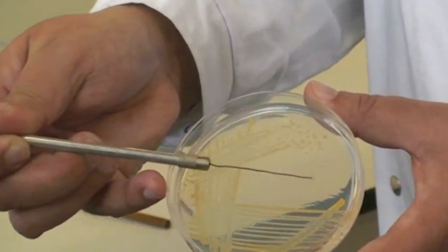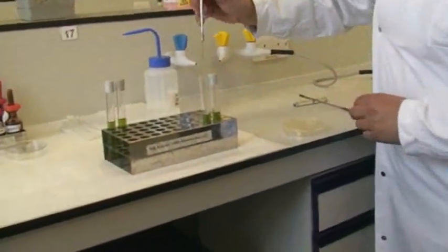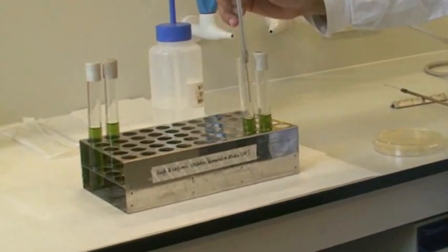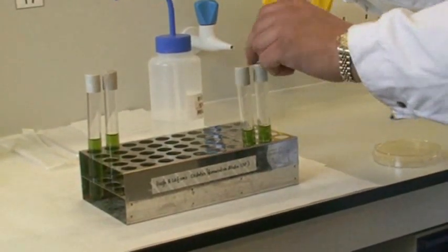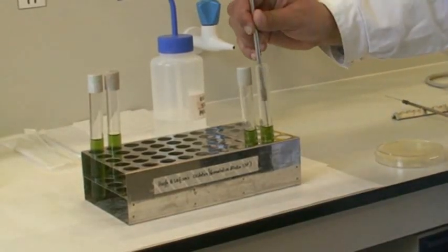And then inoculating first the first tube, going straight down, and then going to the second tube, doing exactly the same, going straight down and inoculating.